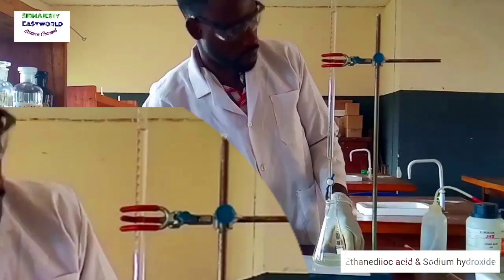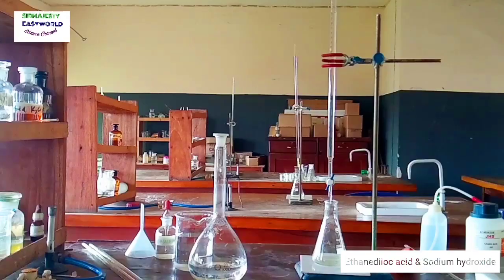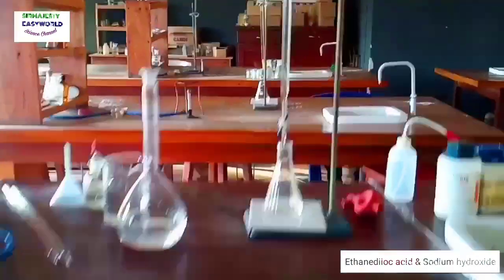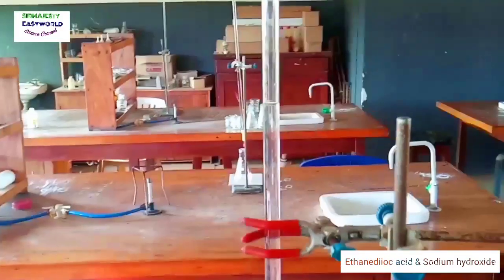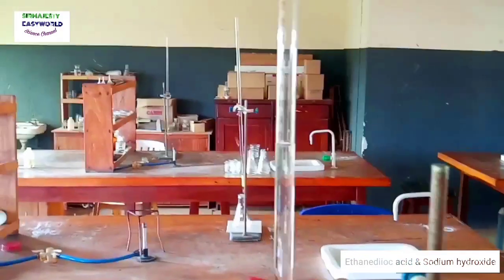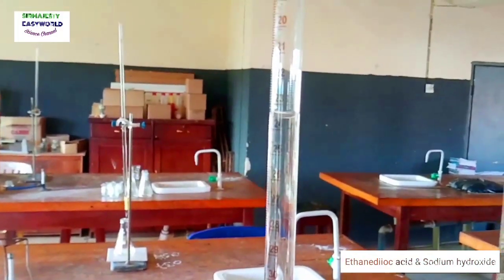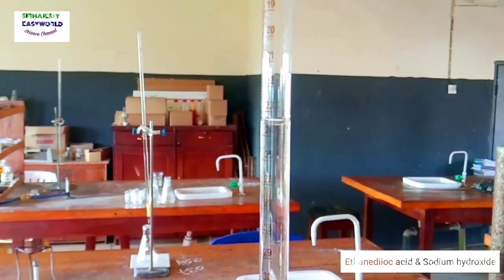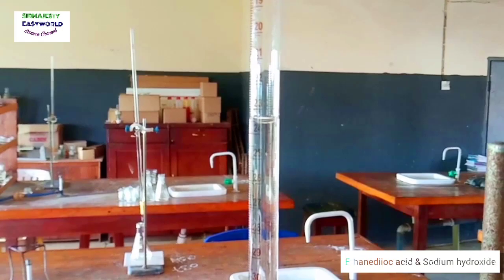The camera is close — you can see the final burette reading is about 23 points. For the rough titre, it looks like 23.5 or 23.6.